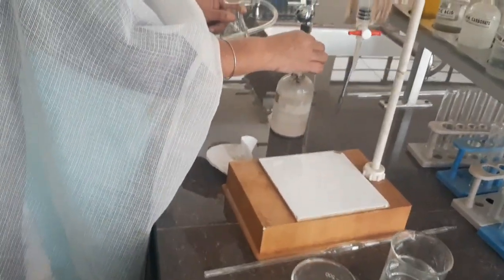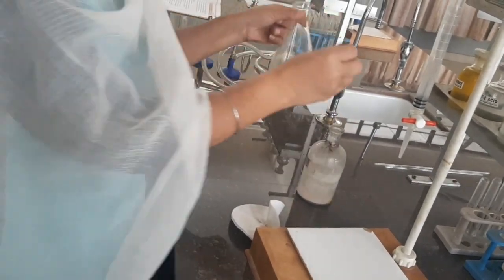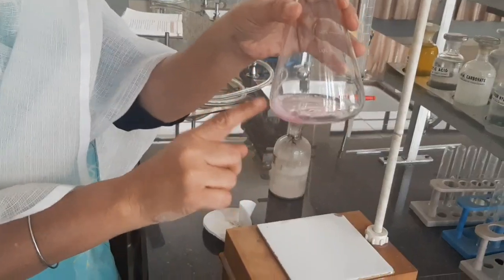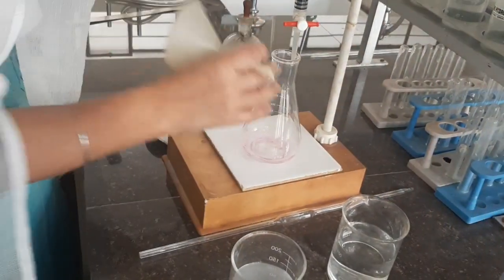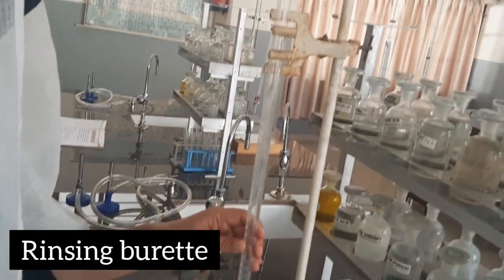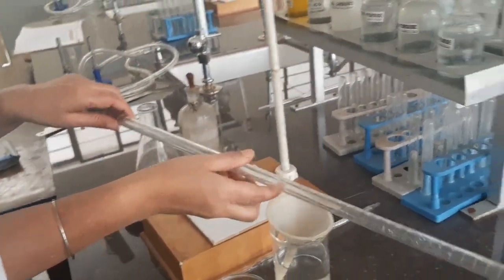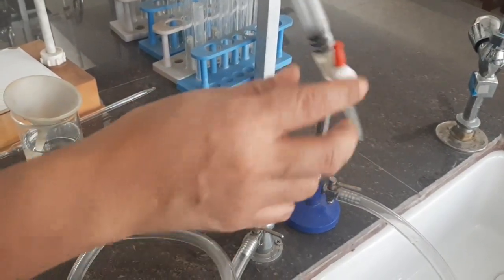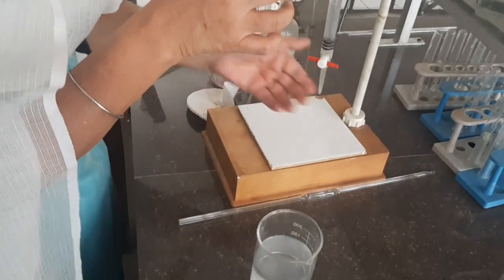To this solution, add one or two drops of phenolphthalein. Adding phenolphthalein turns the solution pink because sodium hydroxide is an alkali, and alkalis show a pink color with phenolphthalein. Now for the titration, pour HCl into the burette. Make sure the end is closed. Pour a small amount of HCl, remove the funnel, swirl it and discard into the sink — this is rinsing. Also let some liquid out from the bottom nozzle to ensure the entire burette is rinsed with HCl. Then refill the burette with HCl.